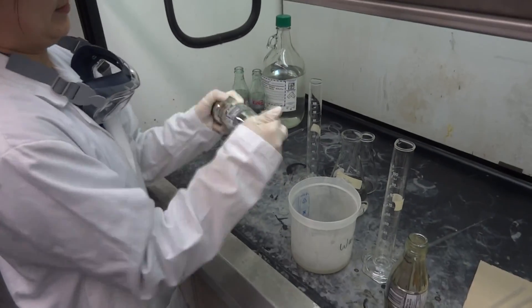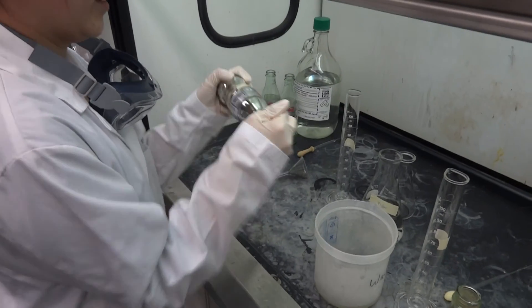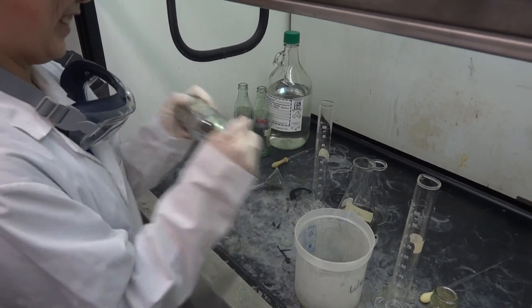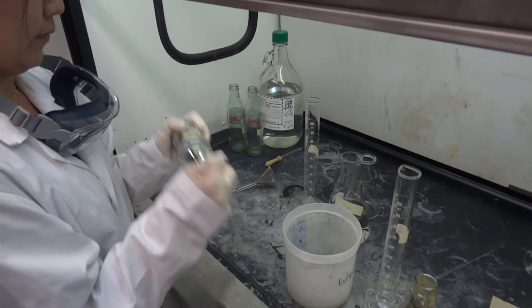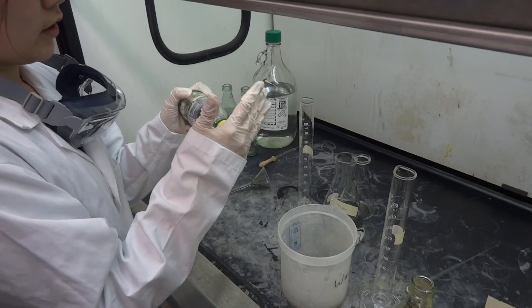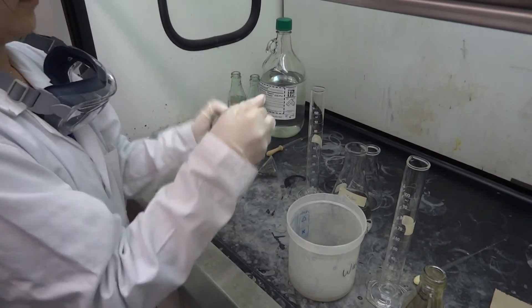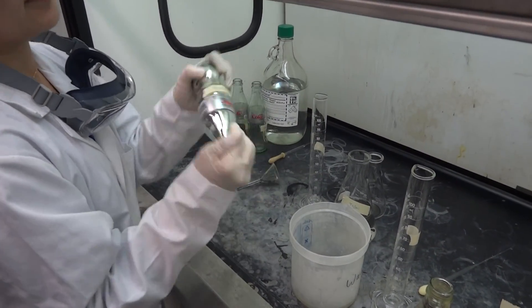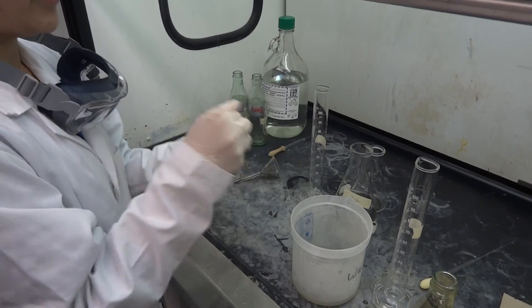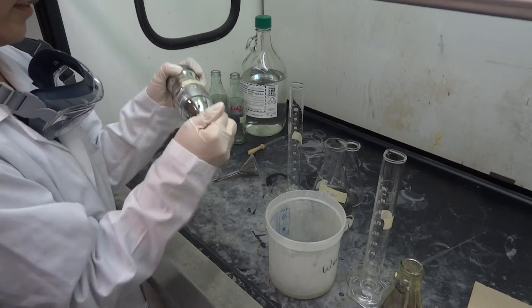When the reaction's done, she's going to put it into waste and then we're just going to rinse it out with some distilled water. It changed color a lot faster than it did when I did it — so it might have been a concentration issue. Maybe she just does a better job. It may have been a different concentration — she added a lot more than a couple of drops.